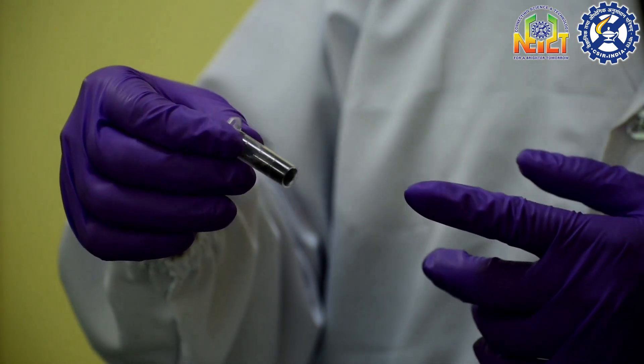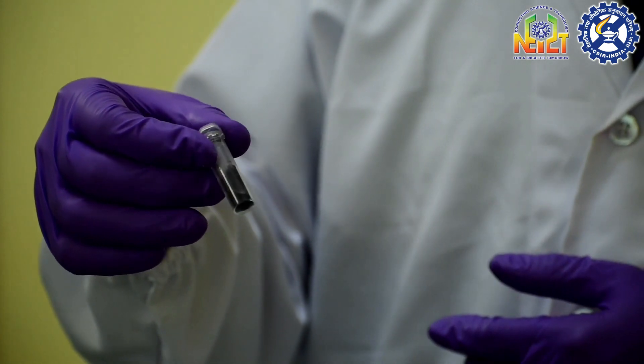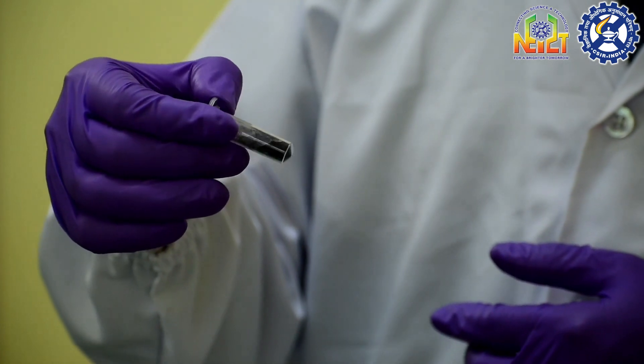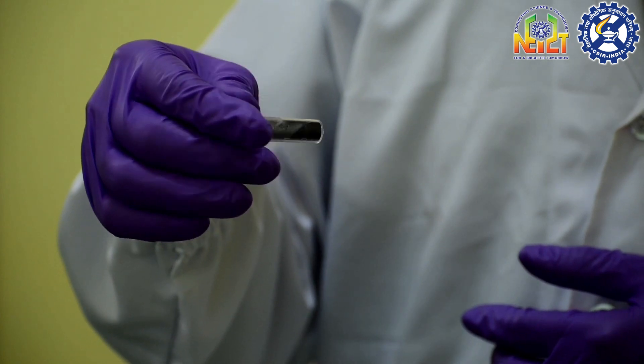Now we have taken some samples. First we have to degas the samples. Then we will proceed for nitrogen gas adsorption on the sample.